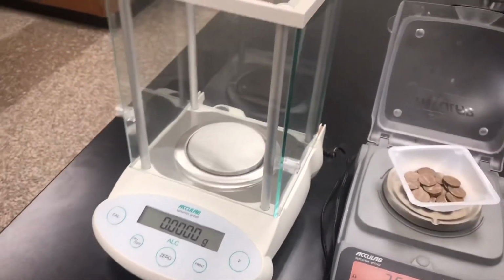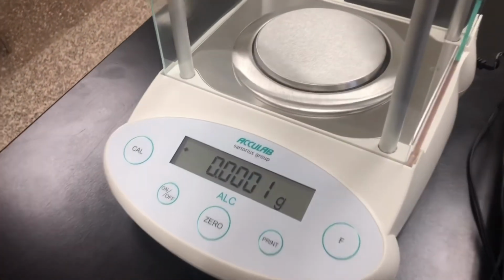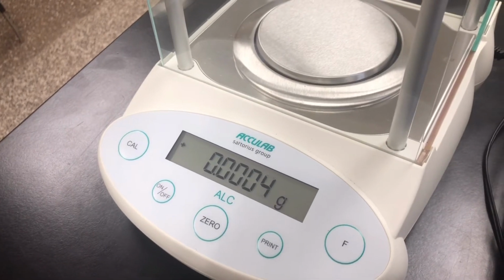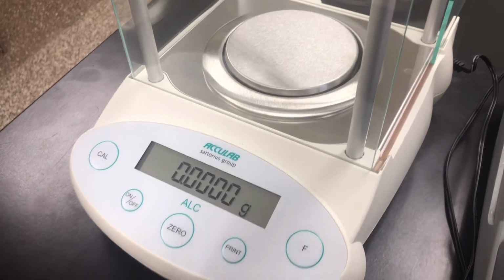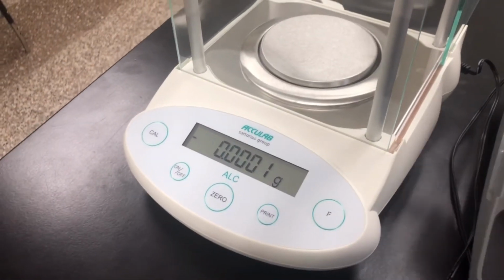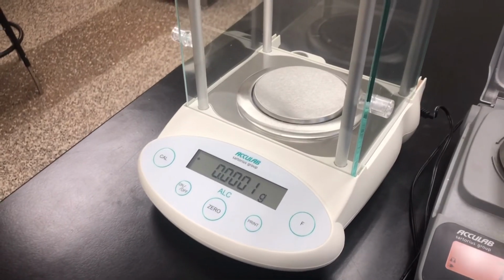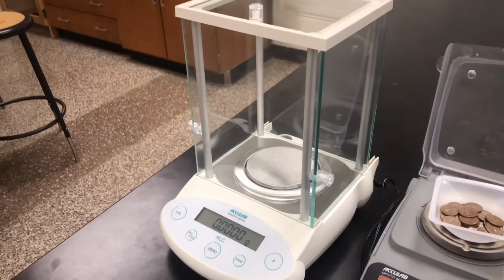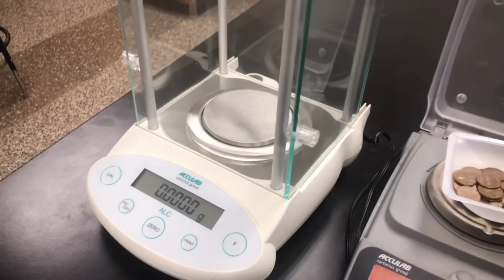And if you just open this, with air going through, you'll see that it is going to measure air flow at 10,000th of a gram. If we were to do that, we would definitely see a difference and we could get a better result. But we're not going to do that with this lab. Obviously, putting pennies on there would be a little rough on it. So we're not going to do that.